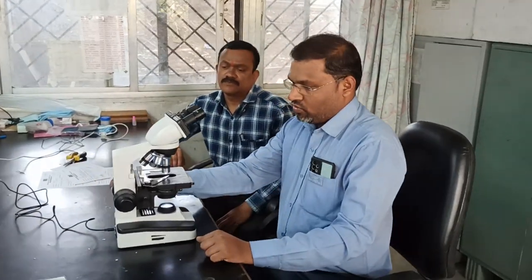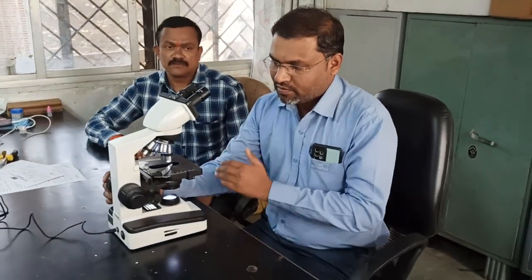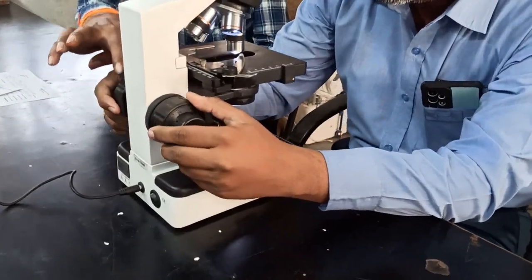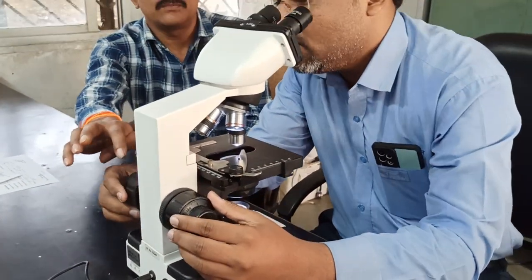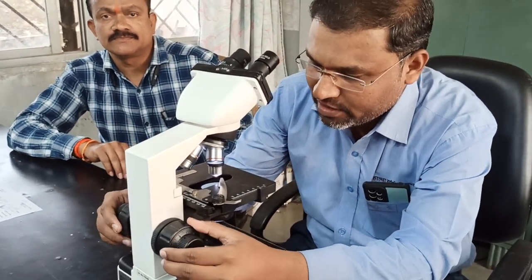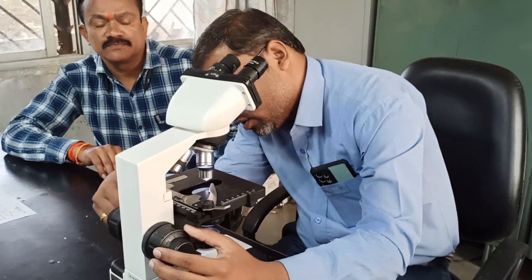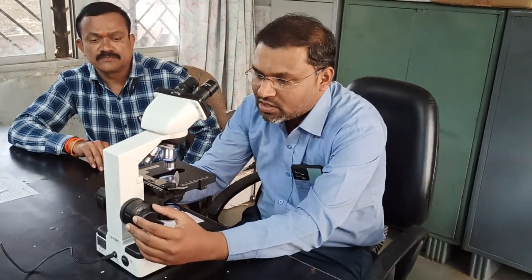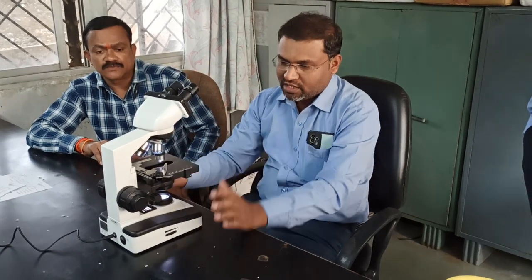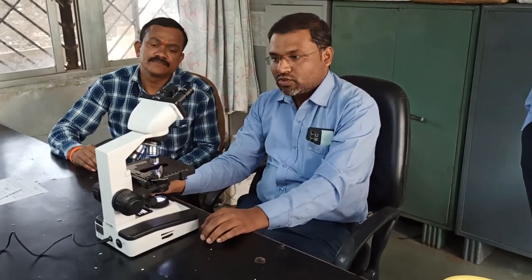And suppose you want to move it up and down, left and right, you can use focusing to adjust the focus. You can adjust these two knobs. These are called fine adjustment, and this is called coarse adjustment, right? So you can adjust the slide also like this. So this is the basics regarding the microscope. Thank you.